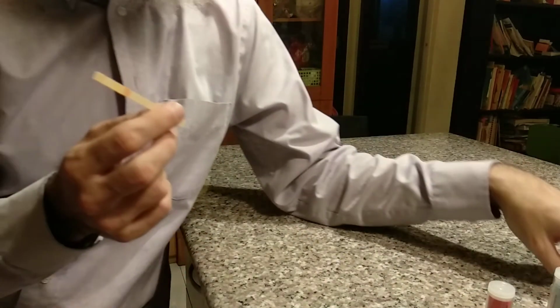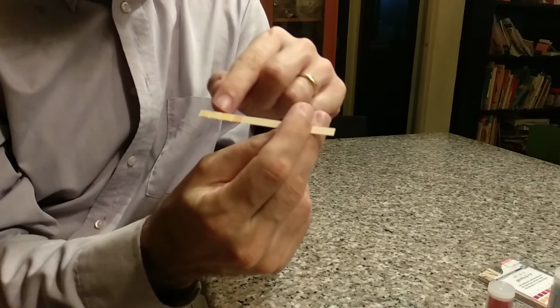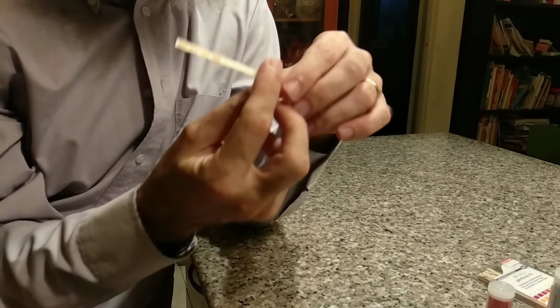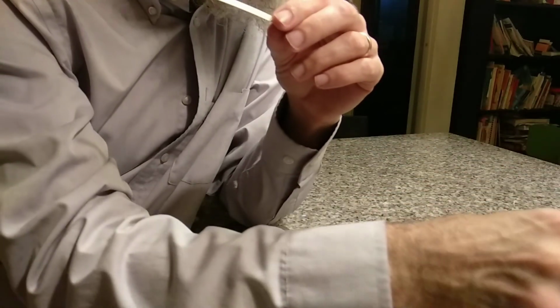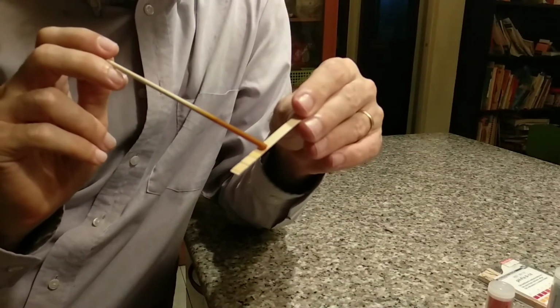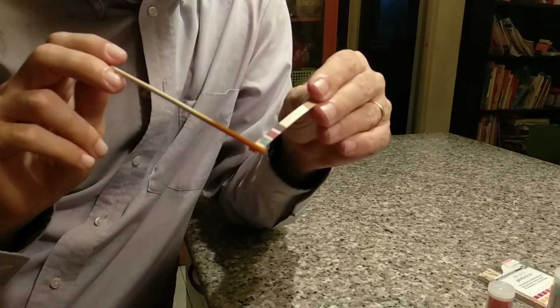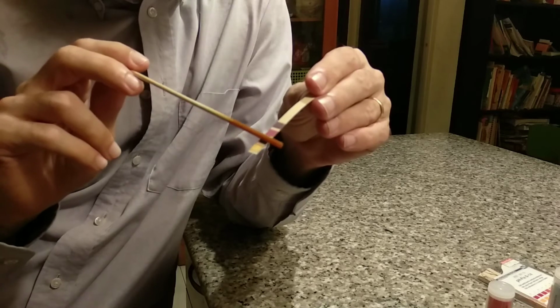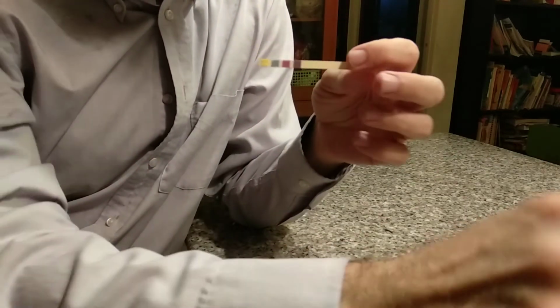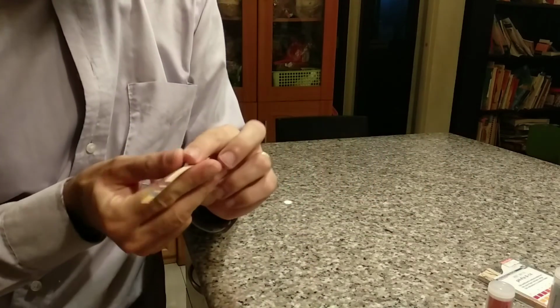Okay? And we want it to be even a little more certain here. This is another type of universal pH indicator paper. This one has 4 different little pieces of paper on the end of it, and if I put my solution on these, I can see what colors they turn, and then that one will help me to see what the pH of this solution is.